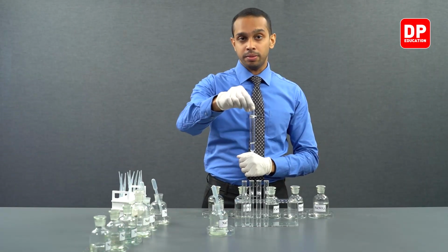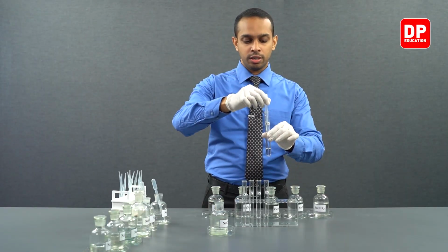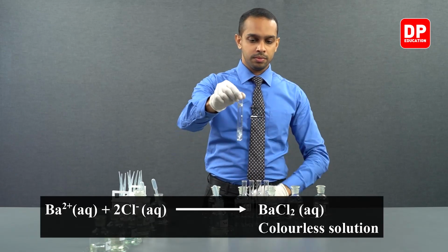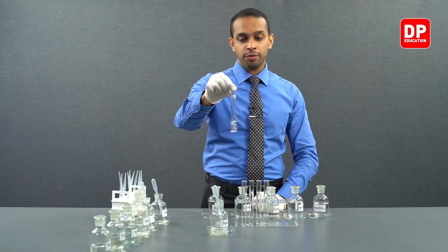Finally, we have our barium 2+ aqueous solution. So let's add a few drops of sodium chloride to that as well. And let's shake it. You can see there are no traces of any precipitate here.